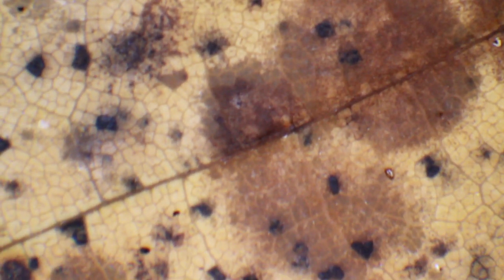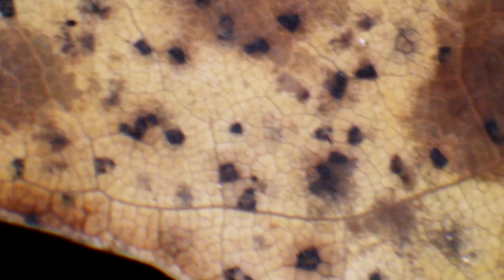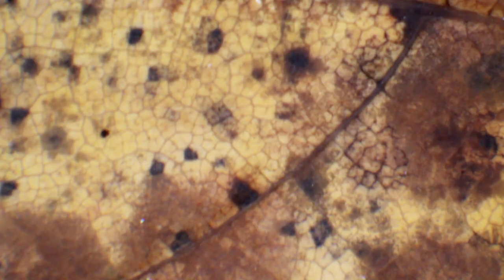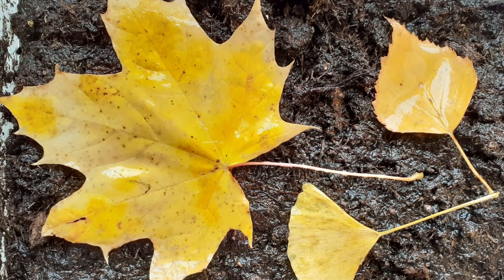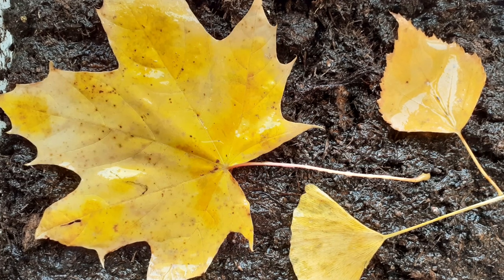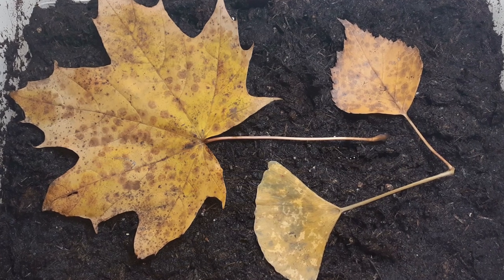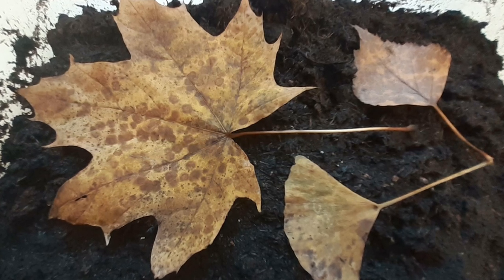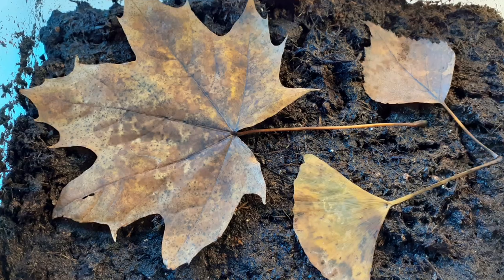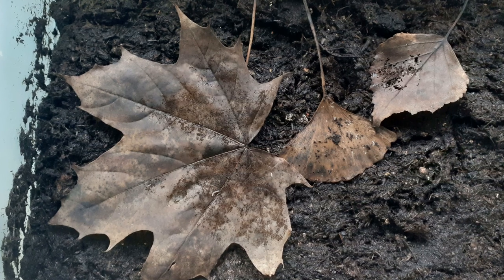Now we start to see for the first time some black spots and also brown ones — there is really something going on. I'm going to give you a complete overview of approximately one month of decomposition. On day one everything was intact. Just a few days later it starts to discolor — it starts to turn brown. The carotenoids start to break down as well. As bacteria and fungi continue to grow, the leaf also starts to become more porous and transparent.